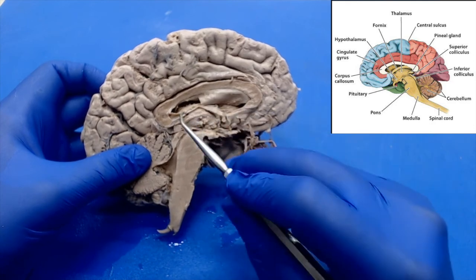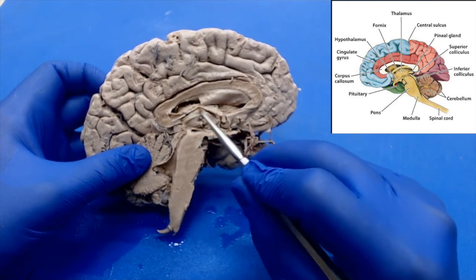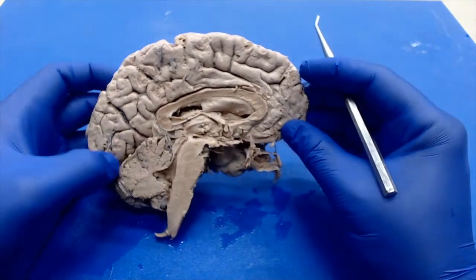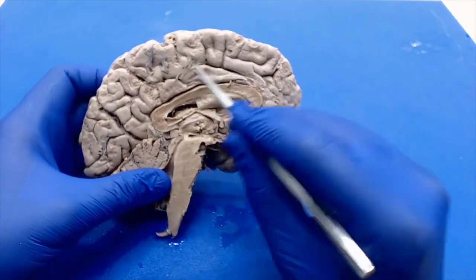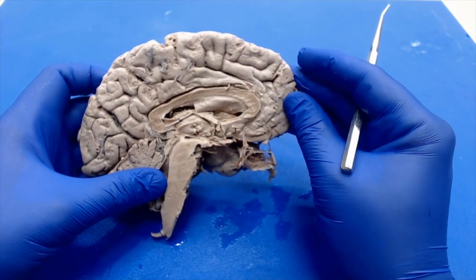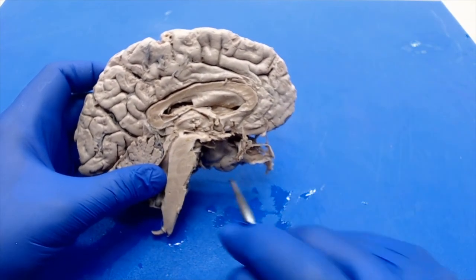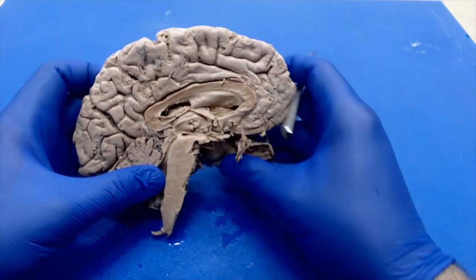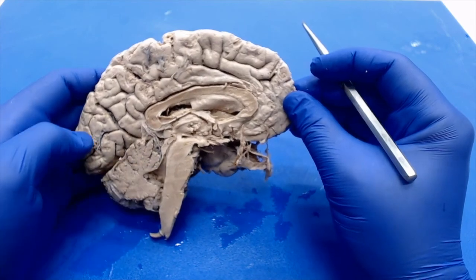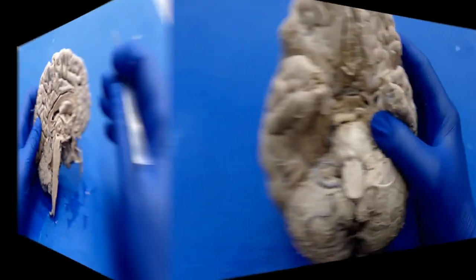And then on top of your thalamus, you actually have the fornix as well. So hopefully you can appreciate, again, the various lobes. We have frontal lobe, parietal lobe, and occipital lobe. Now, keep in mind that we do not see the temporal lobe, except for a little tiny component hanging in the background there, but the other lobes we should be able to see without issue. Okay, so let's take a look at the vascular supply.